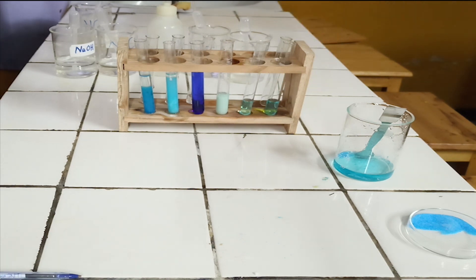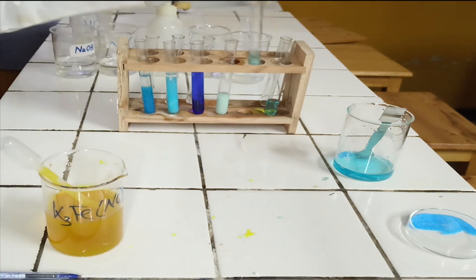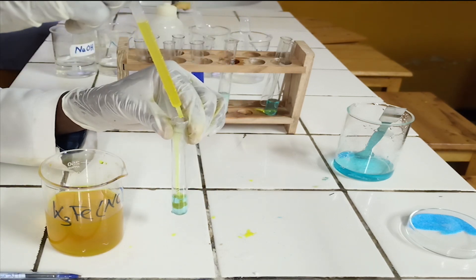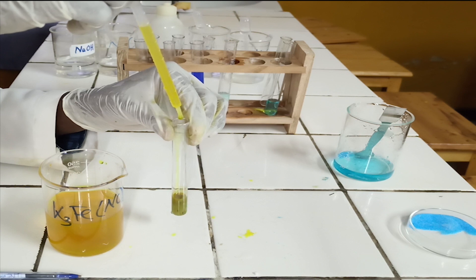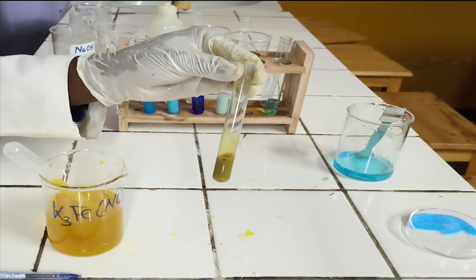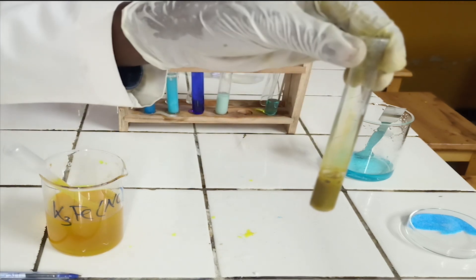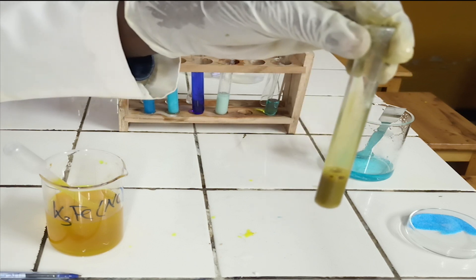Third confirmatory test. To the fifth test tube, add a few drops of potassium hexacyanoferrate solution. As you see, potassium hexacyanoferrate reacts with copper-2-ion to form a brown precipitate.